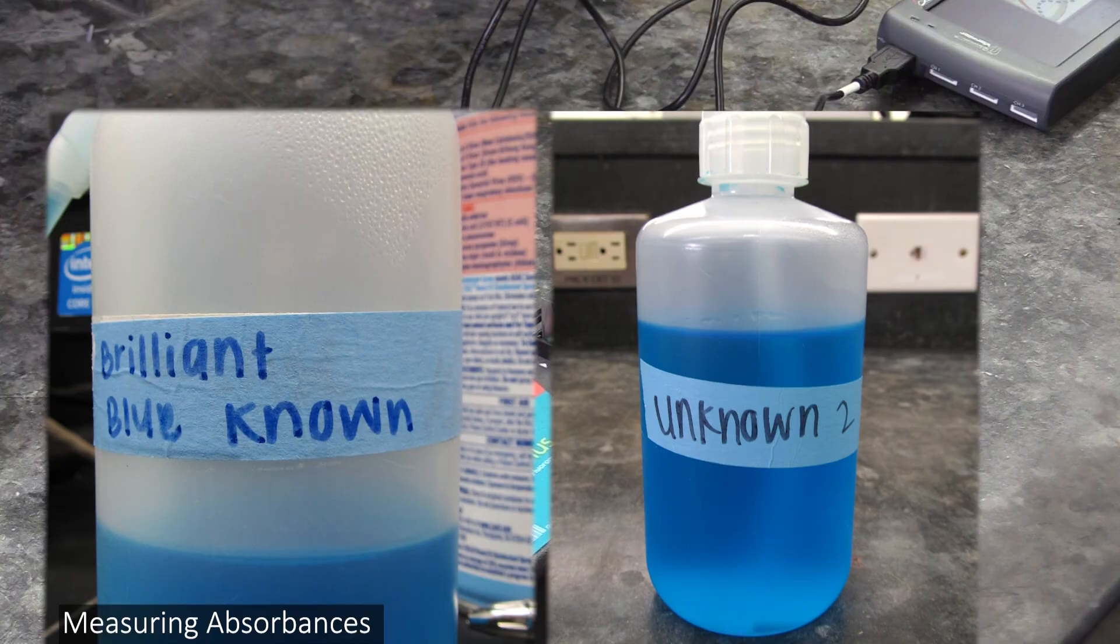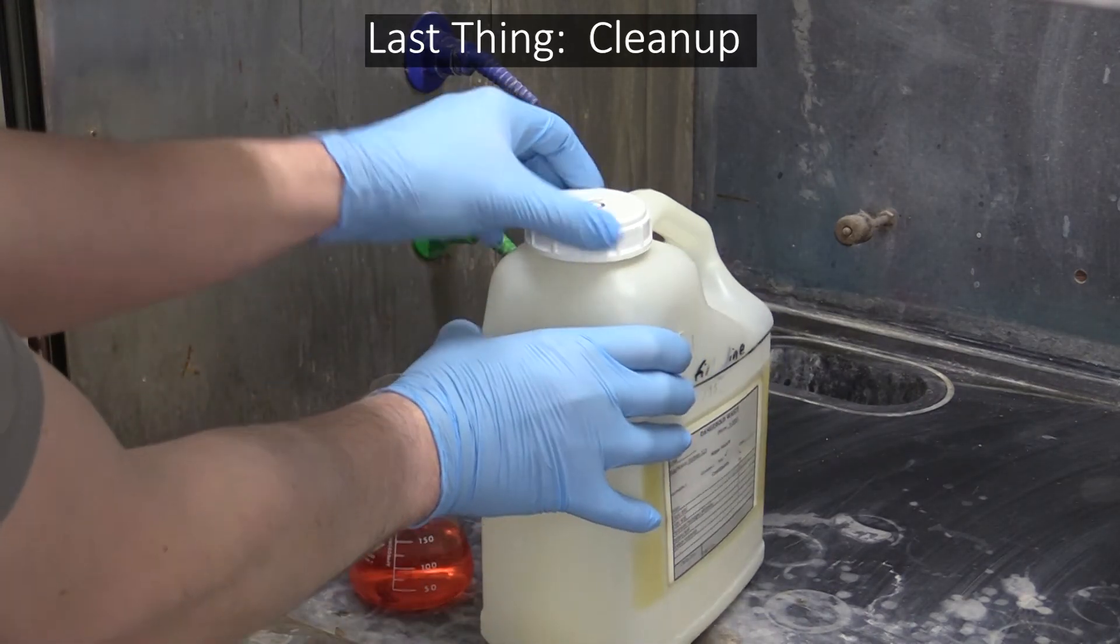After you've done that, measure the absorbances of the known and unknown solutions. And that's pretty much everything you need to do to collect your data.